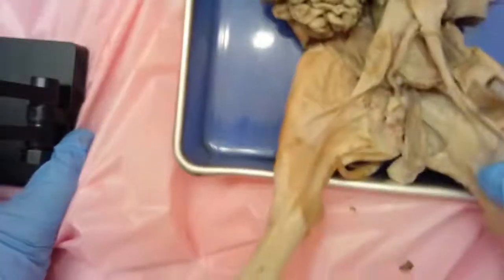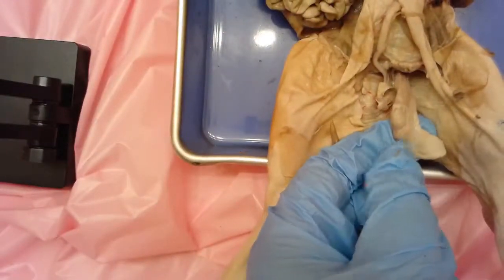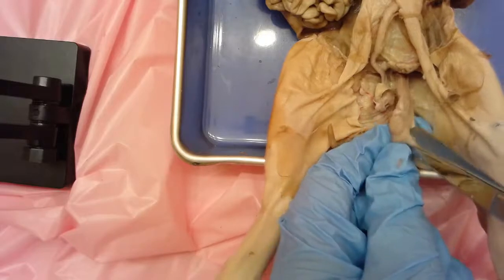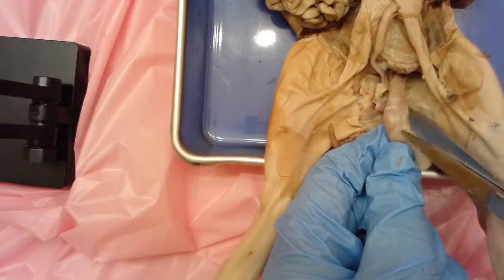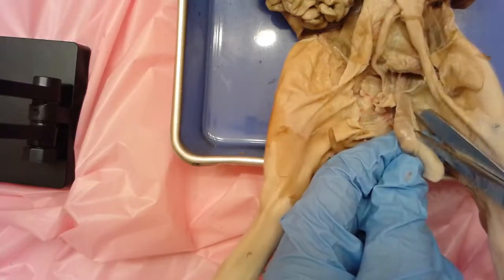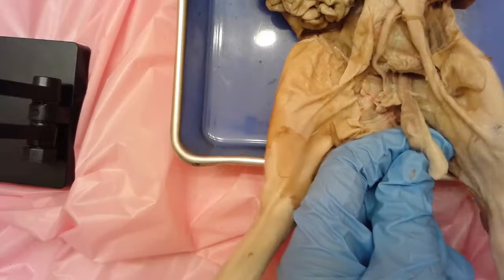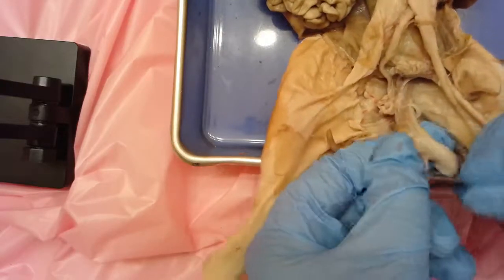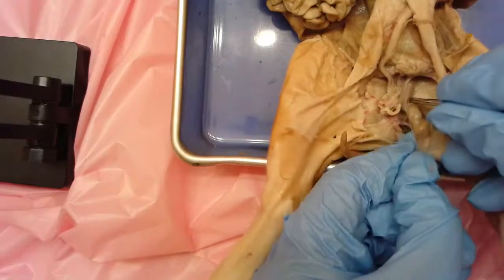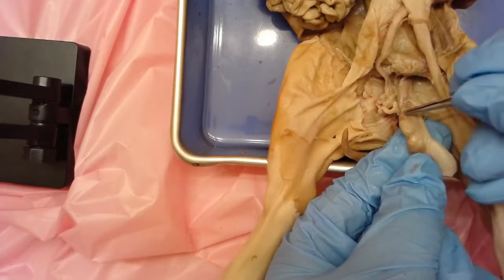Now let's look down at the bottom and dissect this out a little bit better. This skin or membrane covering everything is our scrotal sac, and we want to cut into that to expose the structures so we can see them better. As we cut through this membrane, we can expose the testes. There's a little part going around the outer border - that oval shape in the middle is the testes.